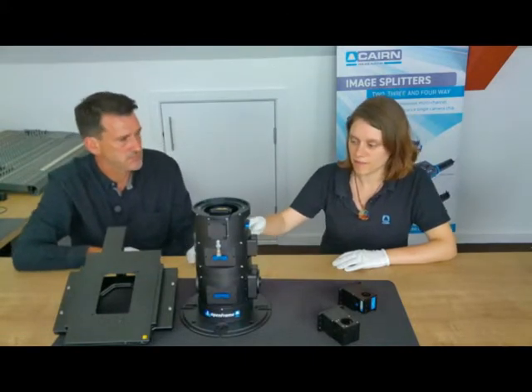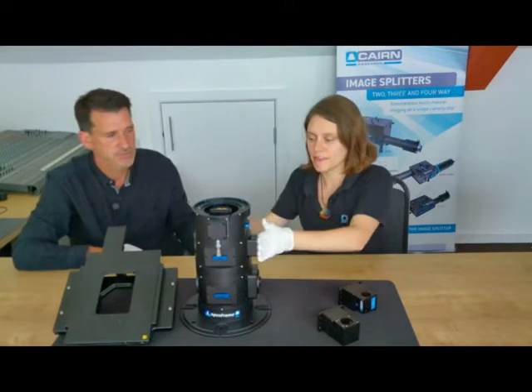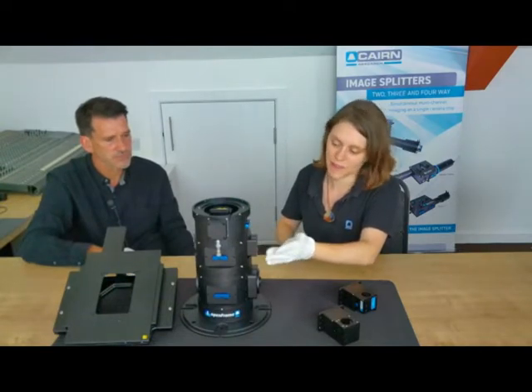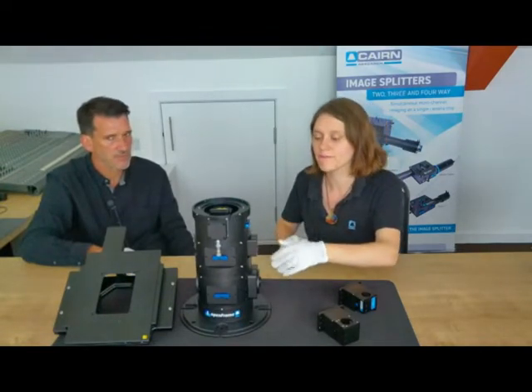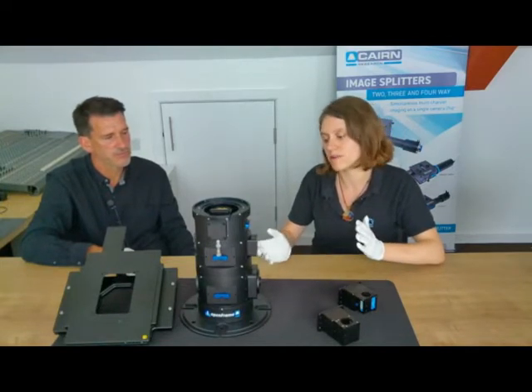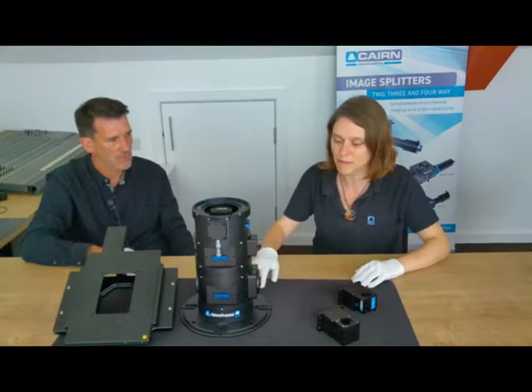And moving down, this is one of our bread and butter layers, the 65mm layer. See on each side it has two mounting points with an SM30 tube bore and 30mm cage output, so you can mount a range of different components. We predominantly use this layer for epifluorescence, so as you'd expect, there's a filter cube in the middle.